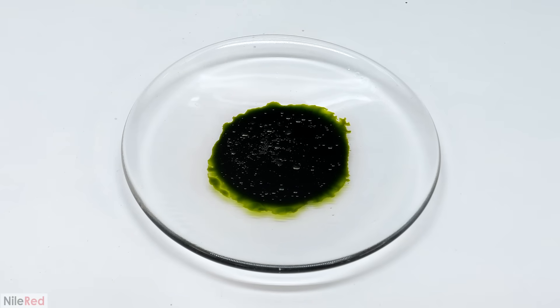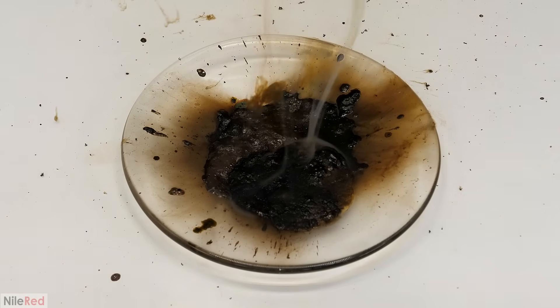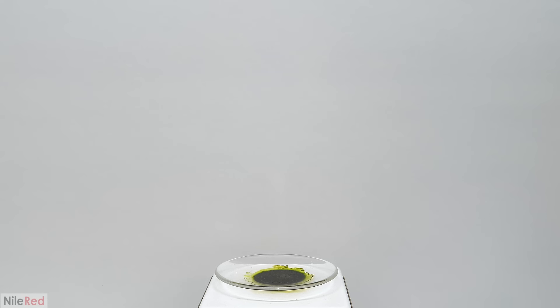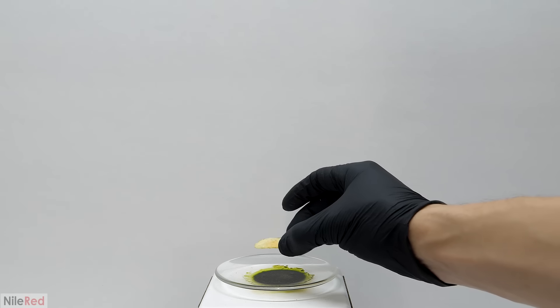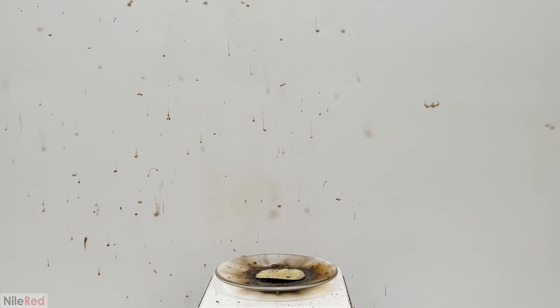For the next run I did it with a potato chip, and it was mostly the oil in it that reacted. This time though, for whatever reason, it let off a lot more manganese dioxide — I did it again from another angle just to really show how much it was letting off. The chip didn't react nearly as much but the effect was pretty much the same, which told me it was probably just the heptoxide decomposing. The manganese dioxide was initially a really fine dust, but once it was in the air for a bit it started to form these small little pieces — still extremely light but now too heavy to just float around.